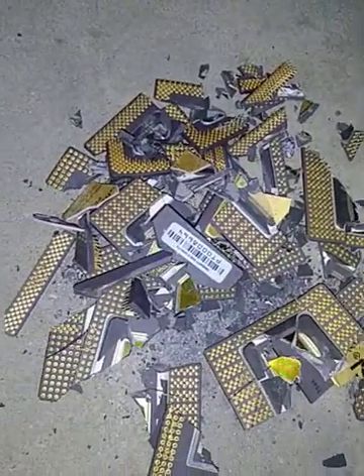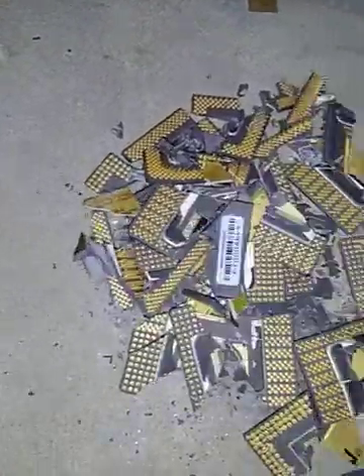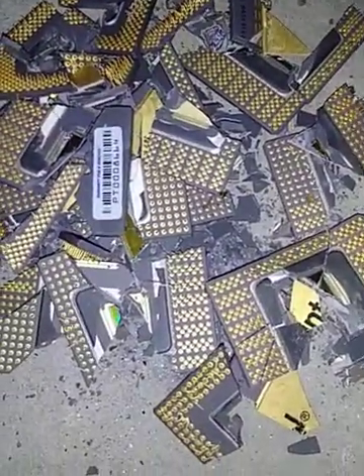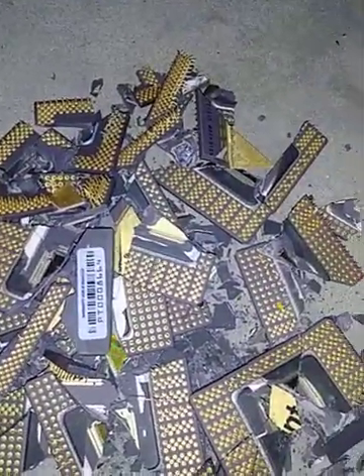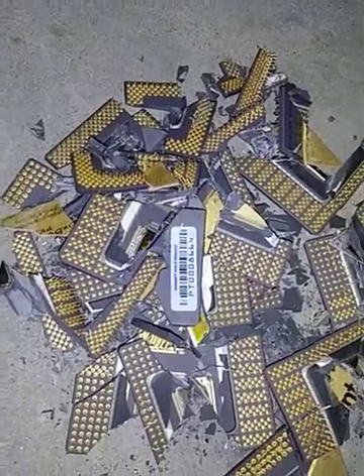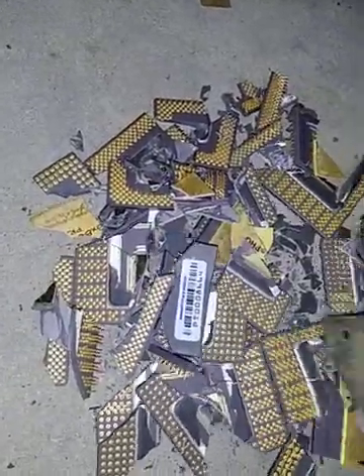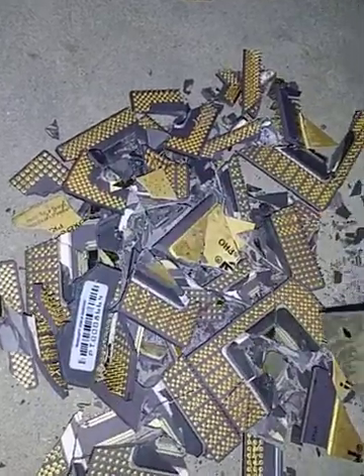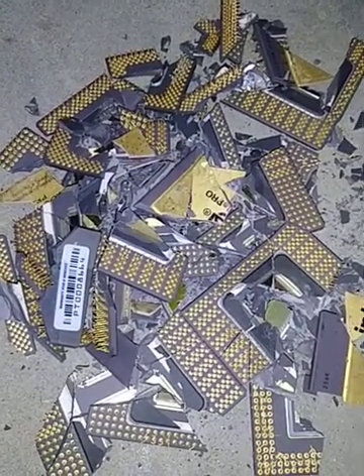Busted up — pins, pros, and all the other stuff. I break them up real good. I try to hit the silicon die as best as possible. I know gold underneath them could get trapped sometimes. I just don't want to have to process these more than once, to make sure I extract all the gold. Next step, we put them in some hydrochloric acid. I'll be back.